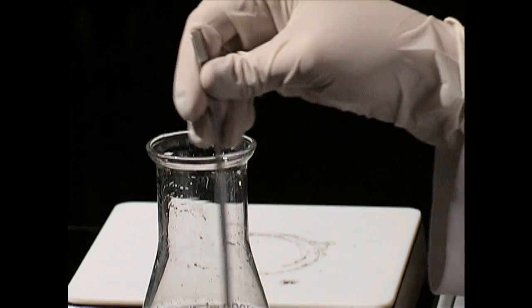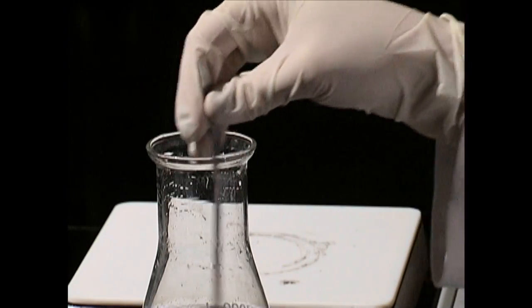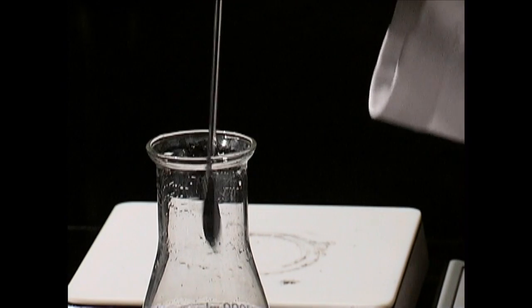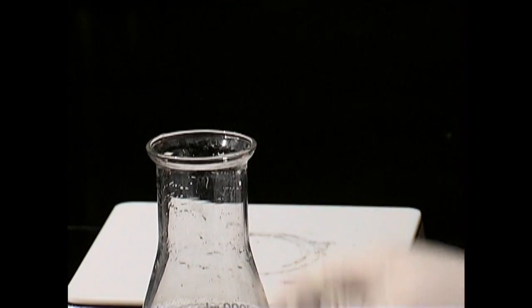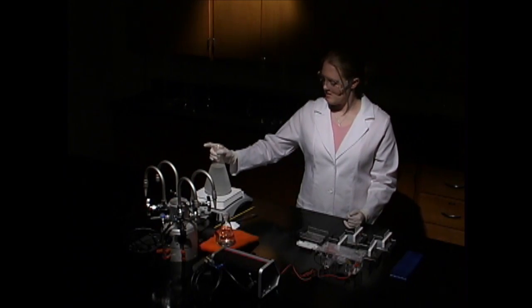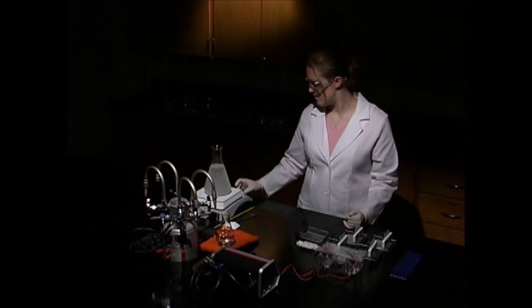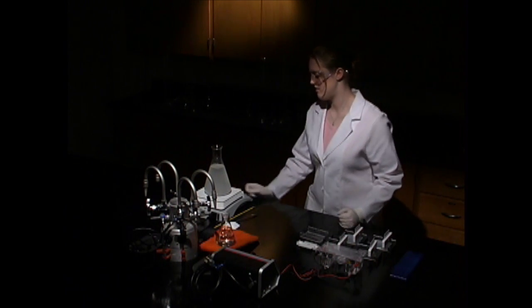To prepare the gel, combine buffer, water, and agarose powder in a flask. Swirl to disperse the clumps. Boil the mixture to dissolve the powder, stirring occasionally. It should become clear like water.